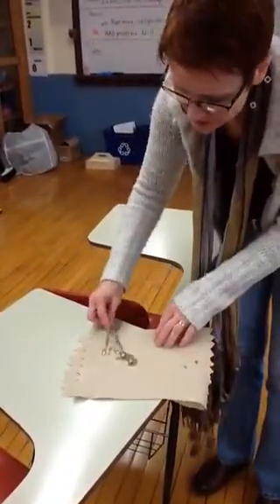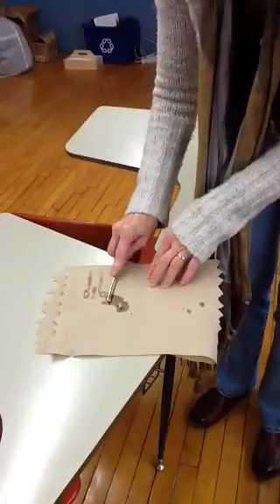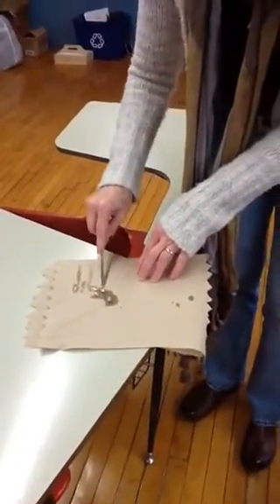But it's a metal — a very soft metal. And this little thing right here doesn't particularly have a sharp edge on it, but it cuts pretty simply and easily. And if you look at the edge of it, it's very shiny. You see the shininess? You guys see that? It's like metal butter.